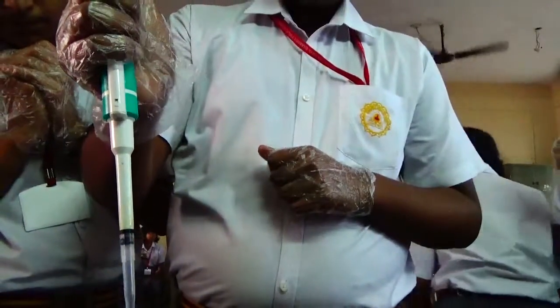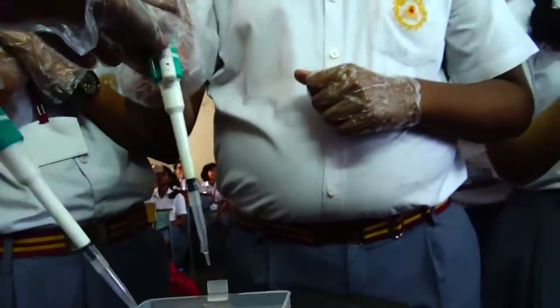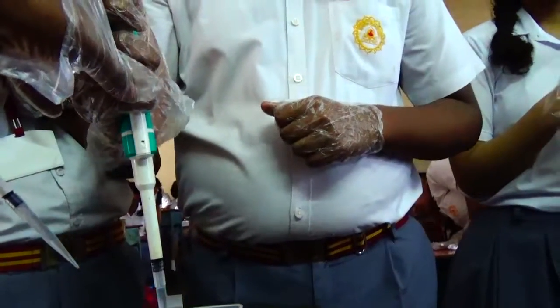No, it's wrong. Wrong. Only this much you have to press. Press it, this much only. This much only. If here, leave the pressure. That is fine value.